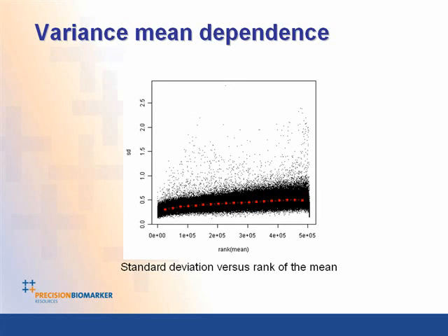Another important test is this variance mean dependence. This is basically looking at the distribution of variance at different levels of fluorescence intensity. As fluorescence intensity increases, sometimes the variance increases along with it. And if it does, that means you're going to bias your analysis to seeing a lot of variance in highly expressed genes and probably missing some of the lower expressed ones. So by looking at the variance of mean dependence, the red dotted line, it should be fairly flat throughout the range of expression.